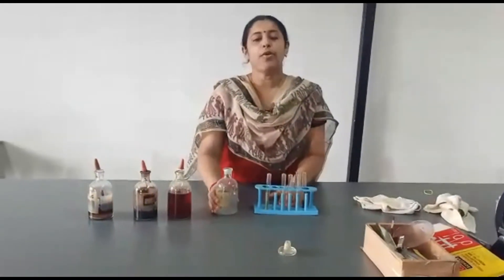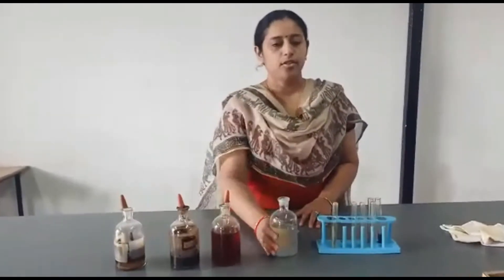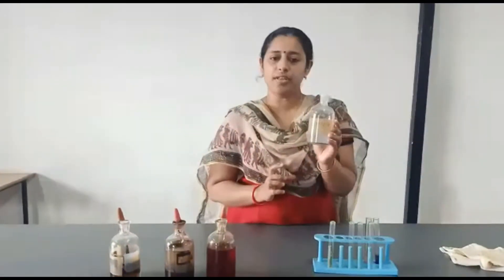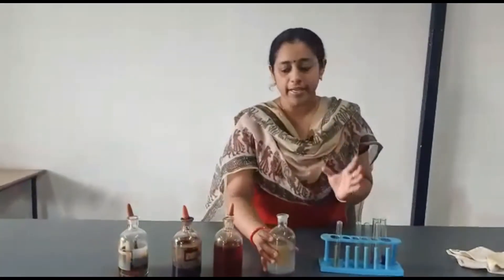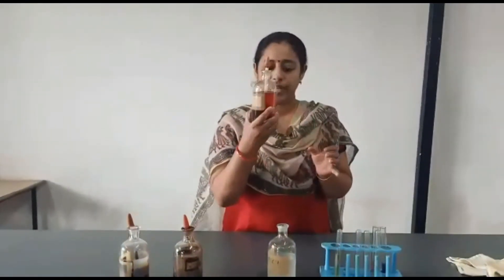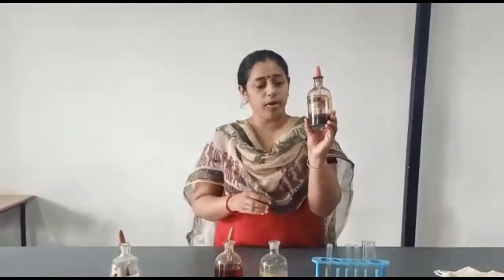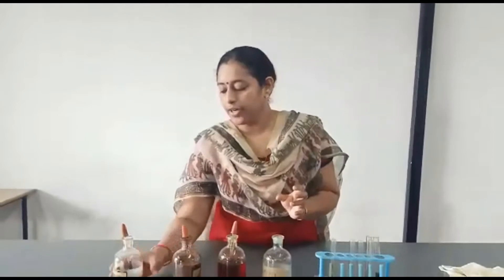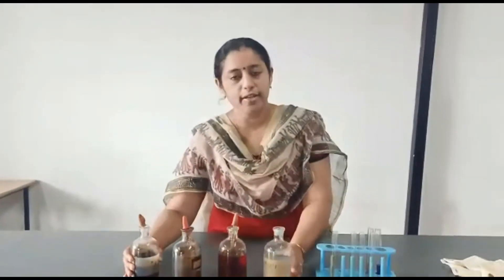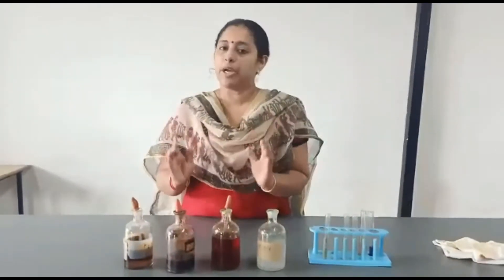Now I am going to tell you how to perform the Biochemical Test for Starch. This is a starch solution — I have already prepared the starch solution. What are the reagents we need for this practical? First, we need iodine. The second is alpha-naphtol, and the third one is H2SO4. So along with the starch solution, these are the 3 reagents we need for this Biochemical Test.